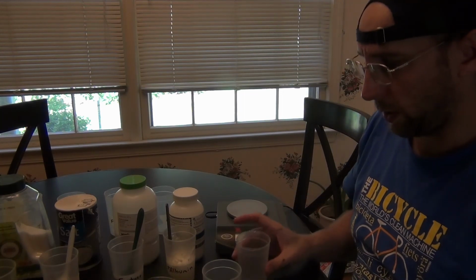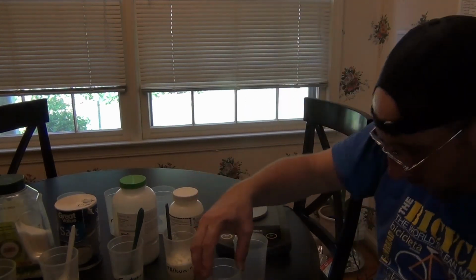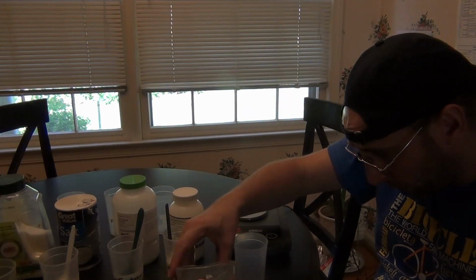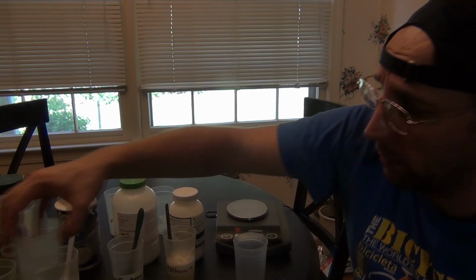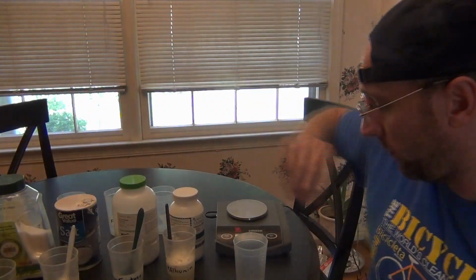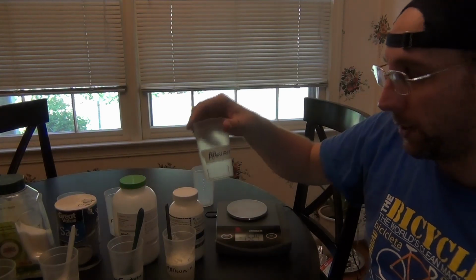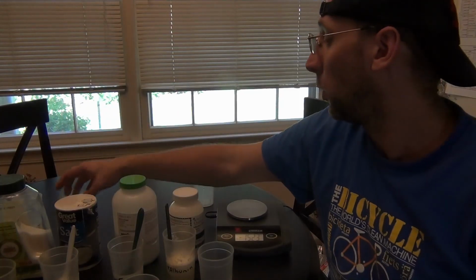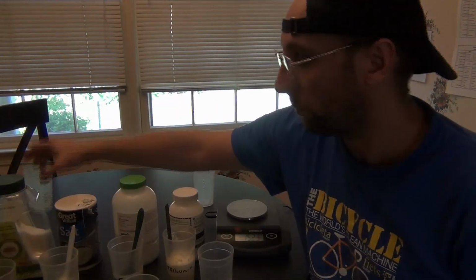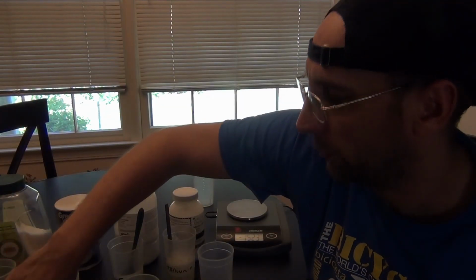And you should have guessed that the control, we're going to use water on the inside and outside. So I'm just going to pour in 100 mils of water in here, although the volume doesn't matter really. We'll see in a minute why it doesn't. Okay, those are all what's going to go inside. And then I have containers for what's going to go outside. Now in all the containers, I'm going to put water in them. Okay, and I'm going to put about 140 mils of water in each of them.